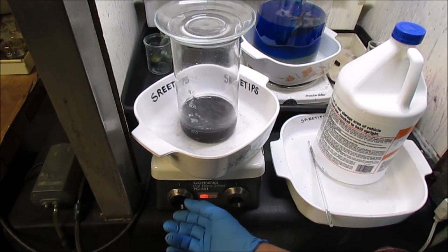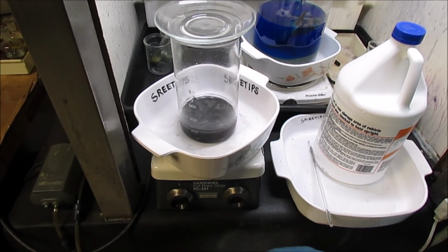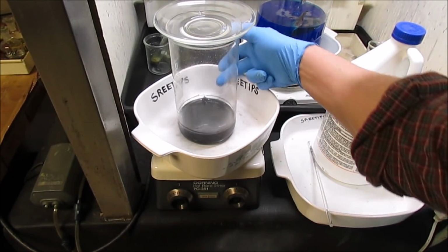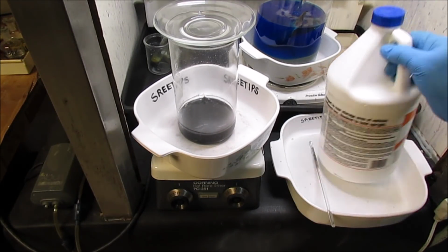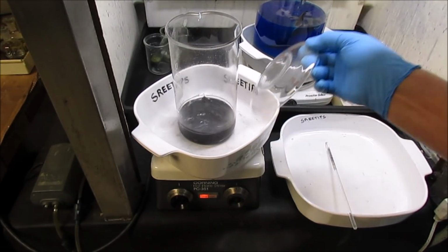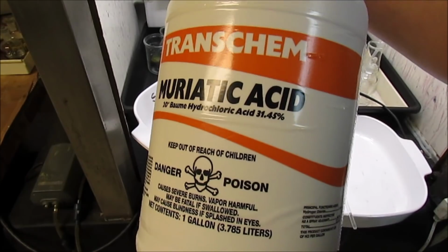This has been stirring now with the hydrochloric acid for several hours, and I'm still seeing a piece of zinc back here. I think I still got zinc in there, so I'm going to add a little bit more hydrochloric acid. Keep stirring for a while. Putting in a little bit more hydrochloric acid.